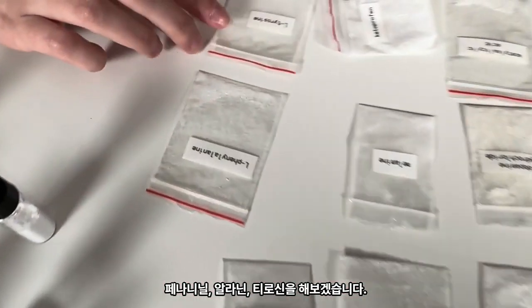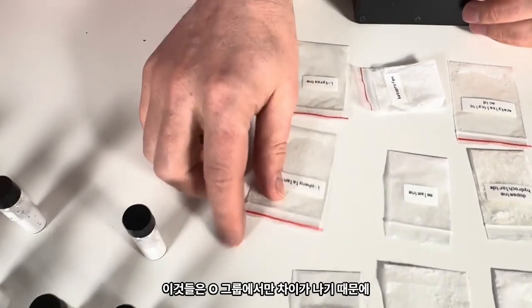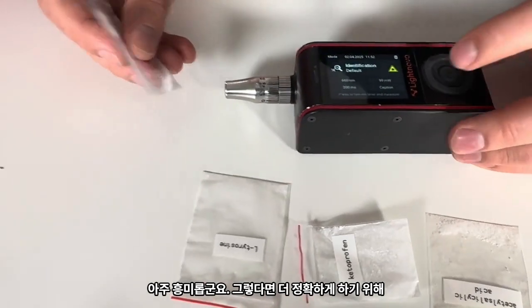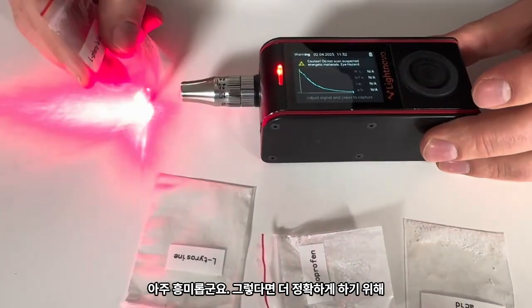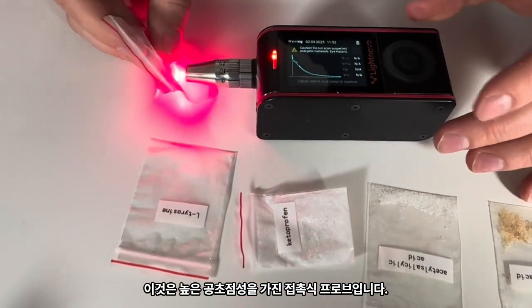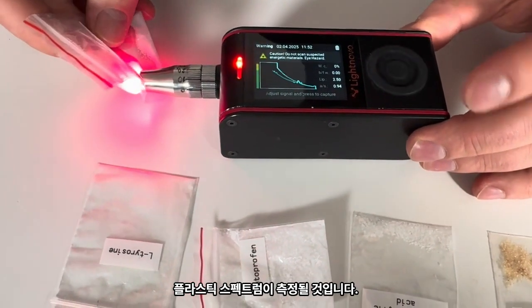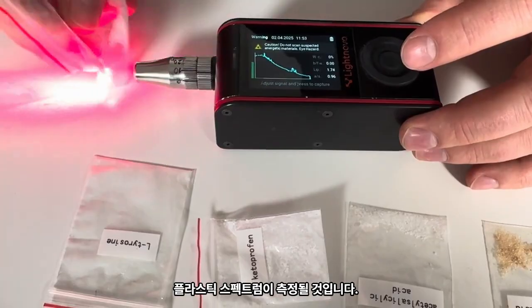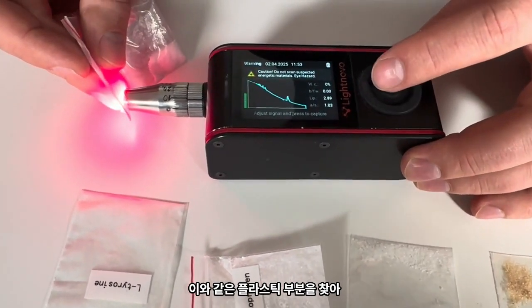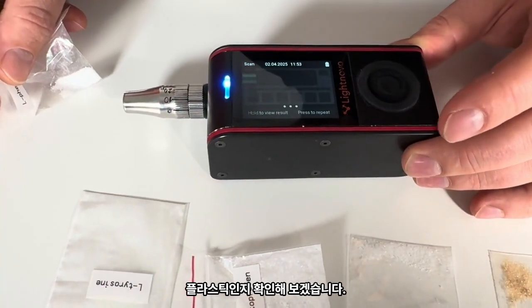So let's do phenylalanine and tyrosine, and this could maybe be difficult to distinguish since it only differs in an OH group. Okay, very interesting. Okay, then to be more precise, let's try something special here. So it's a contact probe with a high confocality. If I touch plastic, just plastic itself, yes, it's gonna measure a spectrum of plastic. Let's find just a plastic part, like this one. And let's check that it's plastic.